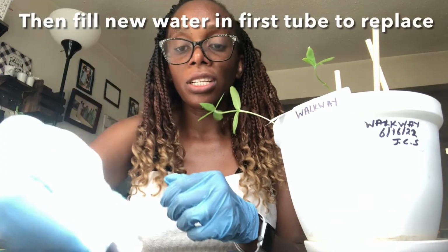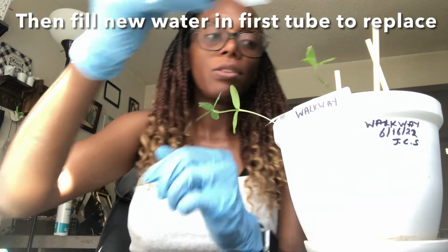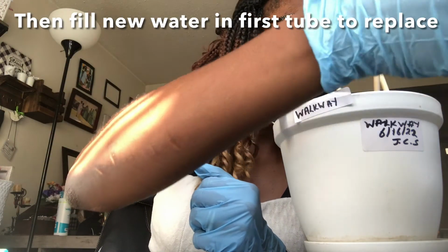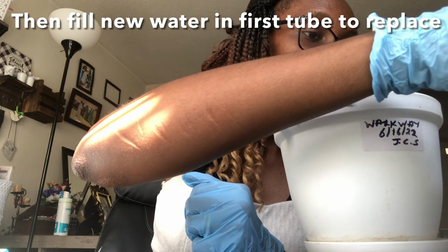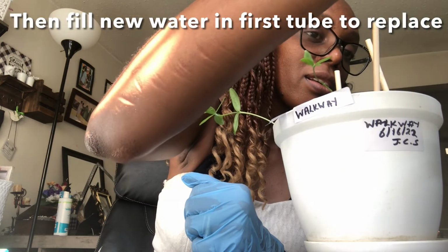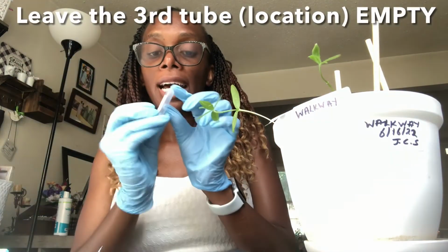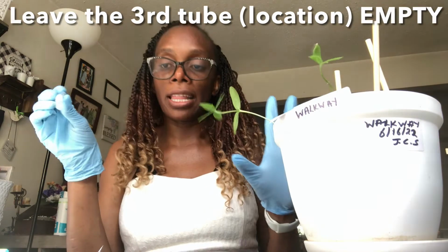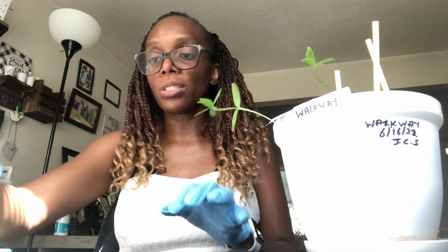Okay, just by inverting. So I have my bleach tube filled, and then I can go back and fill this with the water. All right. Then your third one, which has the location, you don't put anything in there, because eventually you're going to put your root sample. So I will have that over here.